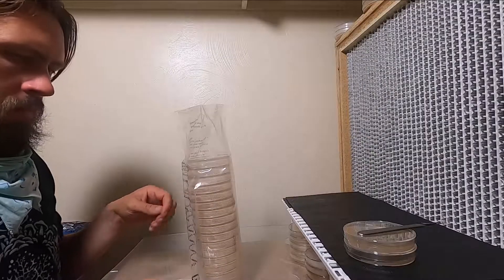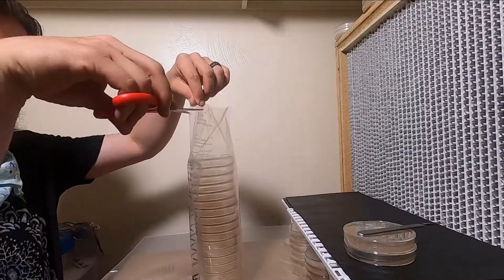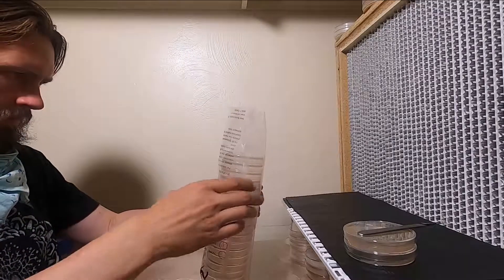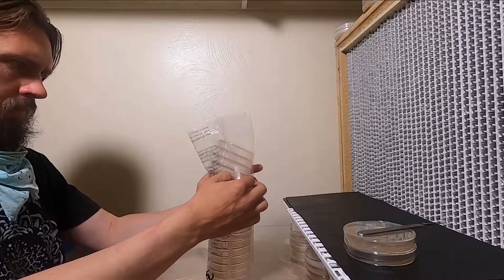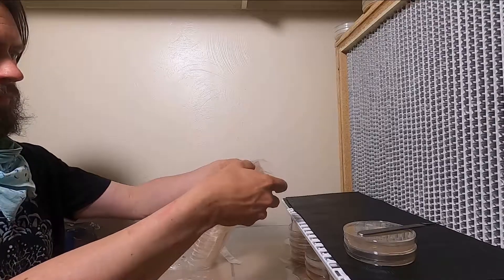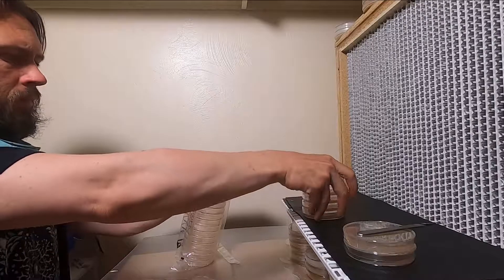So here I have it in the lab, and I'm preparing a few agar plates. I'm going to take four agar plates out and put them on my flow hood bench. Just really trying to be careful to make sure that they stay clean.